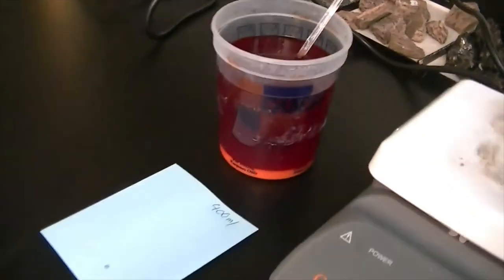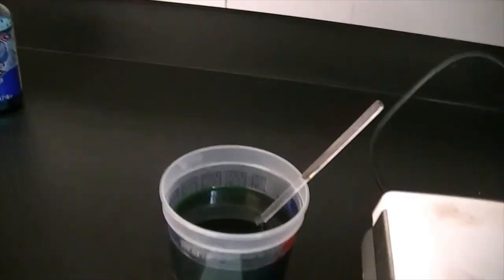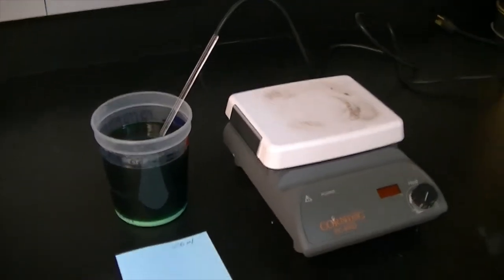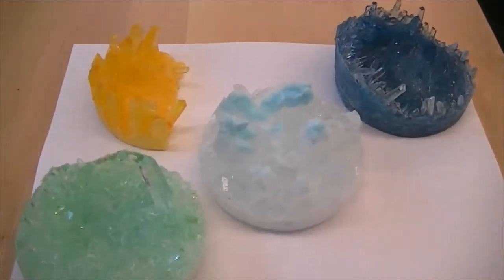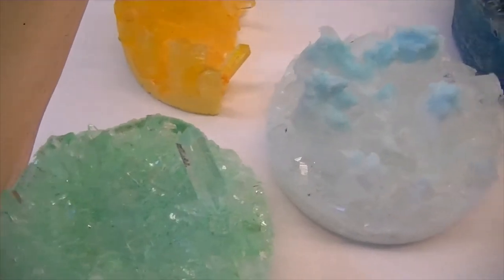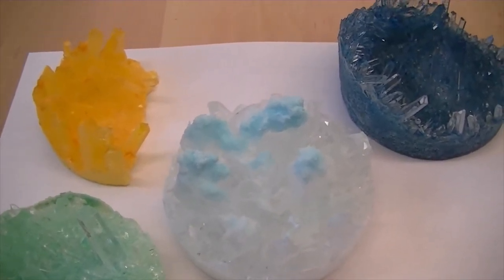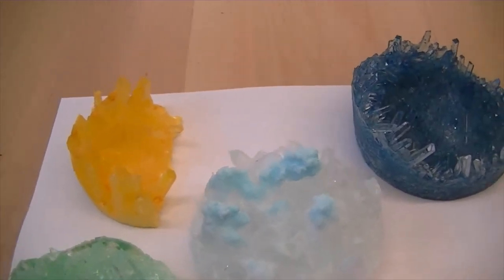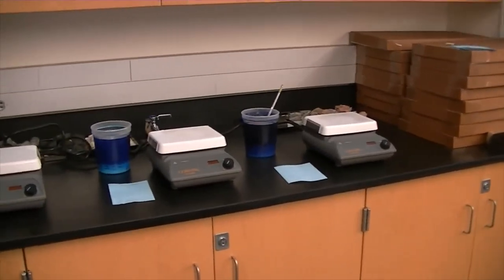There's a whole bunch of hypotheses you can write. You're going to go into Canvas and under Lab you're going to write a hypothesis. At the end of the semester, in the very last lab, we're going to look at our crystals. They start out like this — it takes about eight weeks to grow — and by the end they're rounded because they grew in round containers. Concentrations and food coloring are what varied; all other aspects were identical: same temperature, same volume of water, same chemical, same atmospheric conditions, same room, same day, same time.